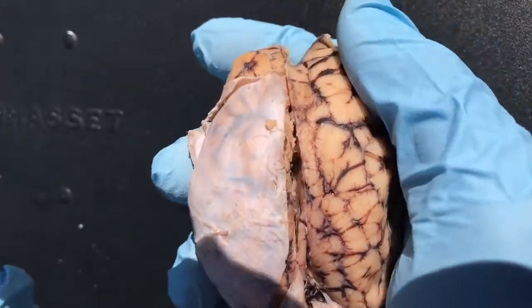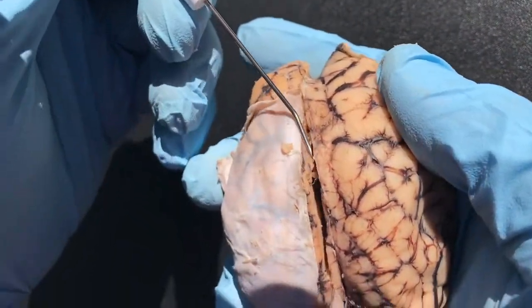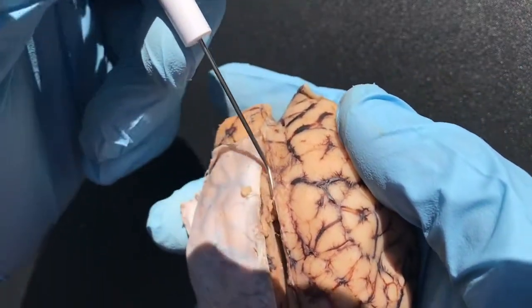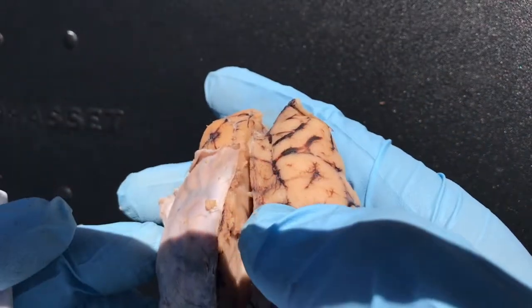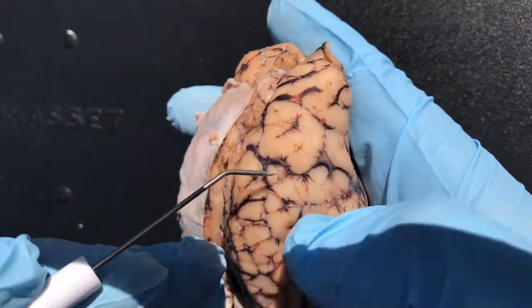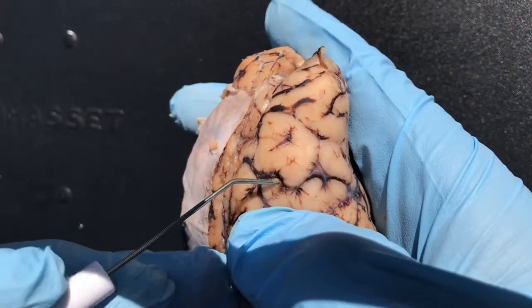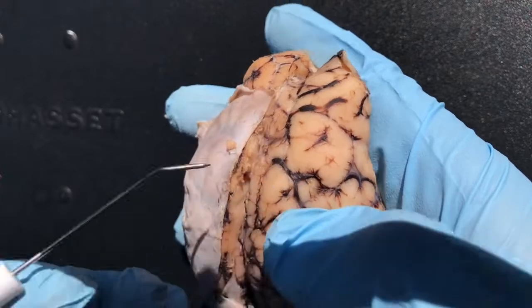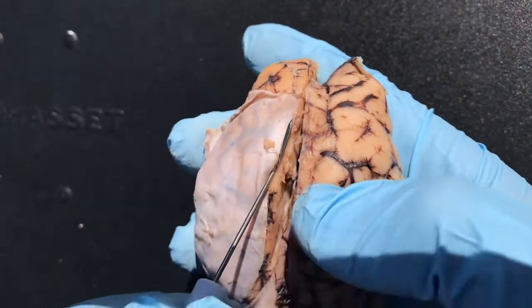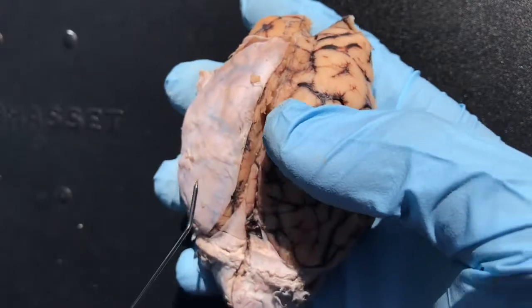You put the brain all back together — here's your longitudinal fissure. A fissure is like a deep sulcus. A sulcus would be like the little valley, where a fissure would be the larger ones, the larger indentation. So here's your longitudinal fissure.